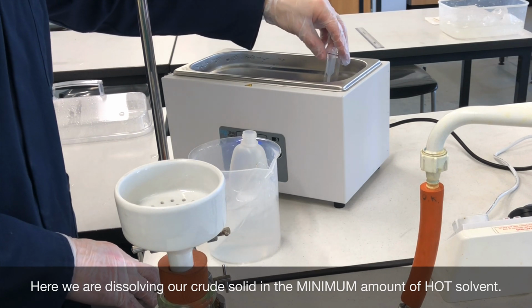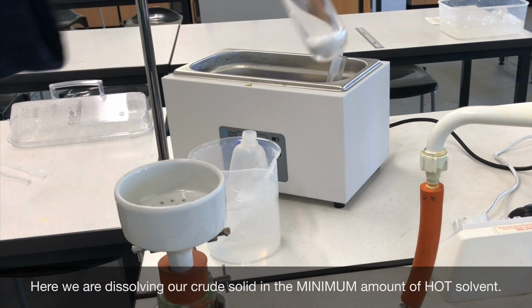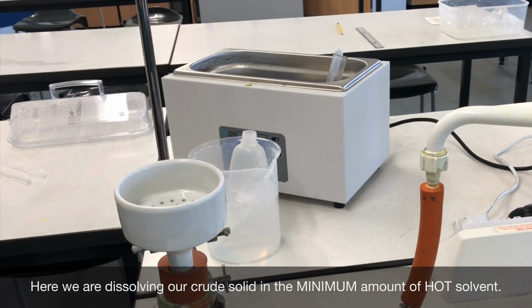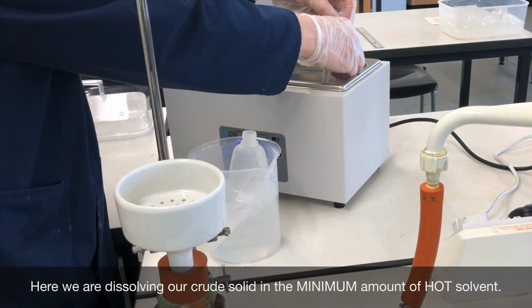Our first step is to take the crude sample and dissolve it in the minimum amount of hot solvent. You must make sure that you mention that it's the minimum amount and you must make sure that it's the hot solvent that gets used. Here you can see I'm using a water bath to do this and two boiling tubes.